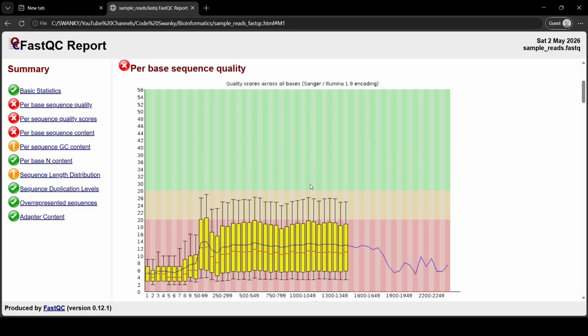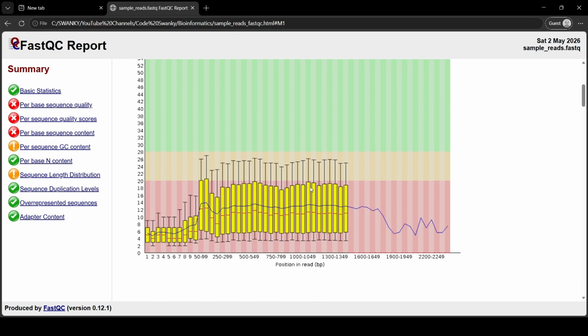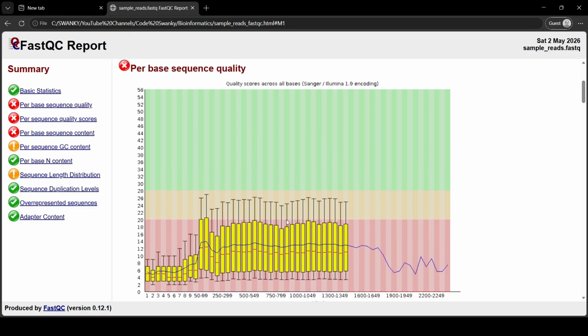But remember what we learned about Illumina sequencing, right? The chemistry degrades over time. So it is perfectly normal to see the yellow boxes slowly dip down into the orange or red zone as you get to the right side of the graph, which is the end of the reads. But in this file, you can see basically everything is in the red zone. So this is a very bad quality read.